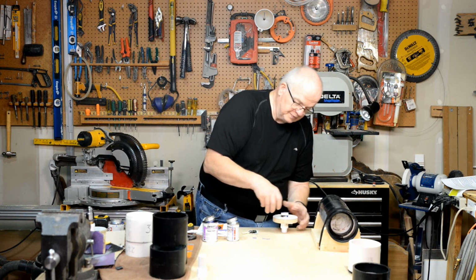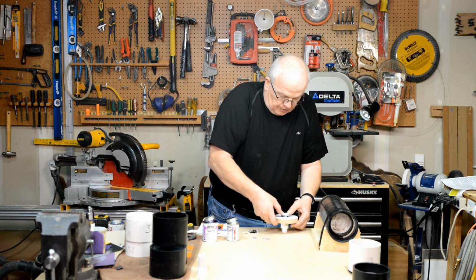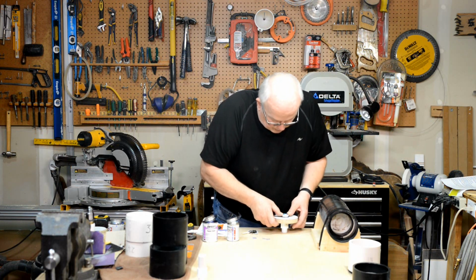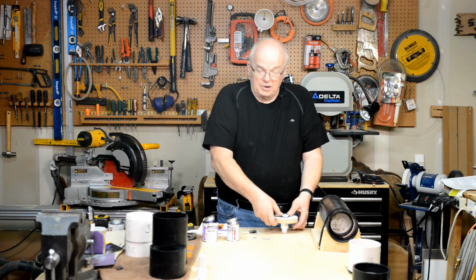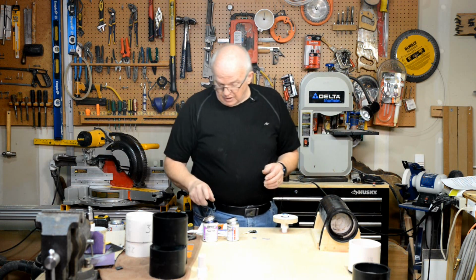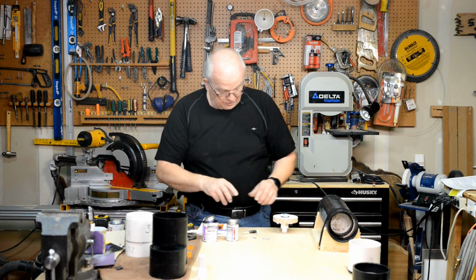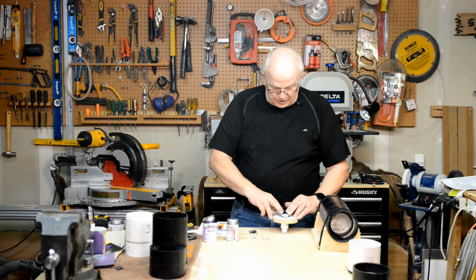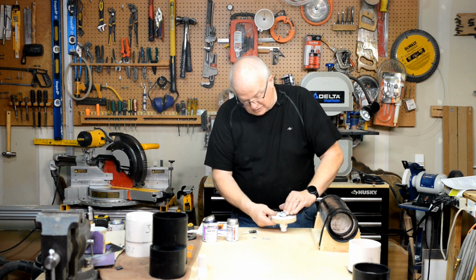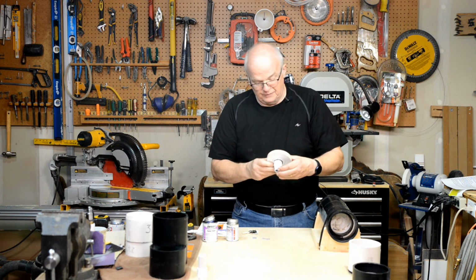Take this, slide it down onto there, slide it down tight, and you're going to notice that that epoxy is squeezing out all over the place. Leave it on for just a second. That cement will grab it. It only takes about 10 seconds. That cement will grab it down tight. But you want to push it so that you've got a tight seal on both sides.